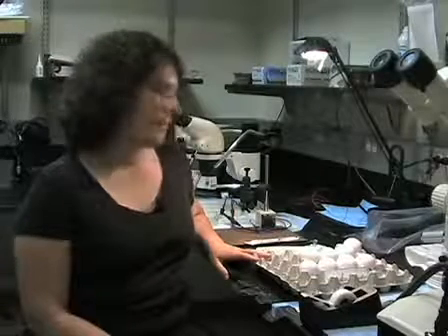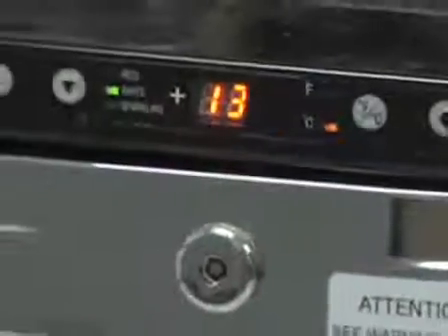Before we get started, I'd like to tell you a little bit about proper egg handling. So the eggs will be purchased from a chicken breeder, and they will come fertilized. Because these eggs contain embryos, you want to be careful about the way you handle them. So prior to incubation, the eggs should be kept at 13 degrees.